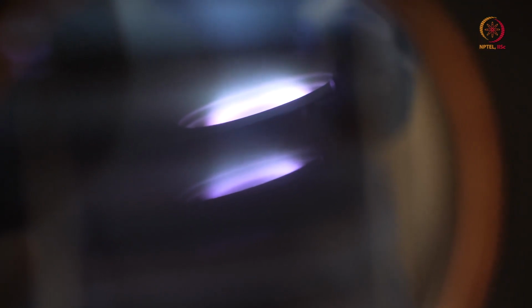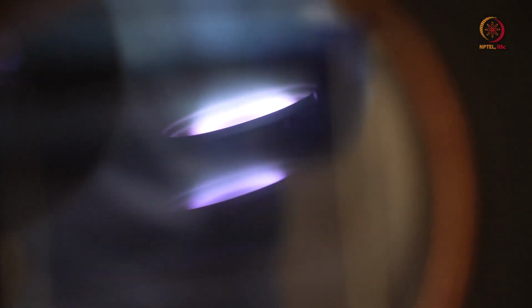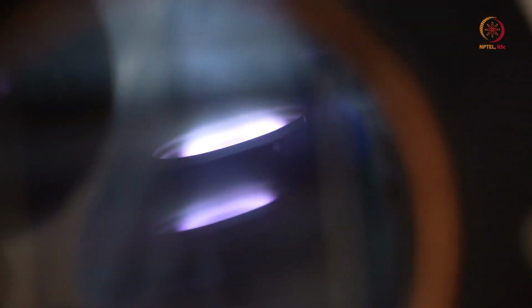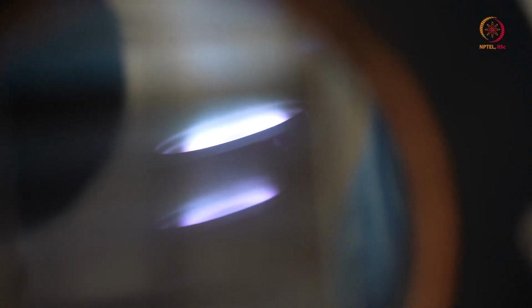So this is the color. So with power, the color of plasma will change. So that is something we were supposed to show you. So here what we tried actually is, in our case we usually use these type of parameters only, more than 150 watt. So that color will be like this, and whatever it is deposited, we will show you in some time, whenever our deposition is over, we can show you the things.